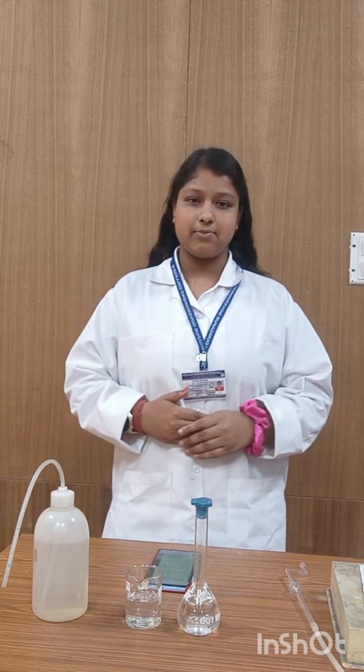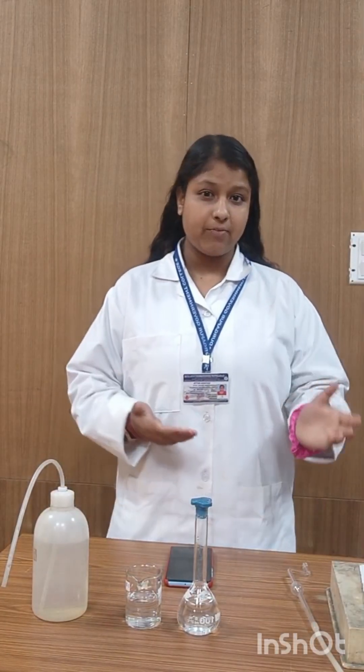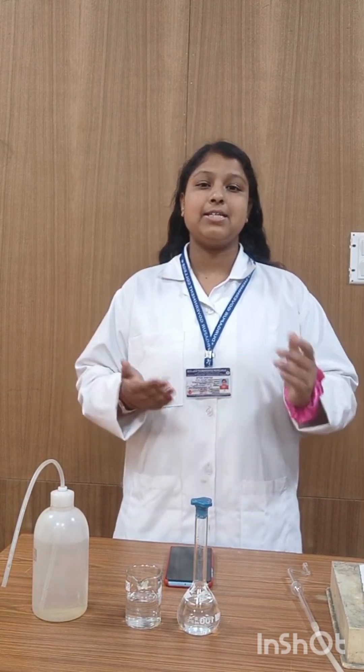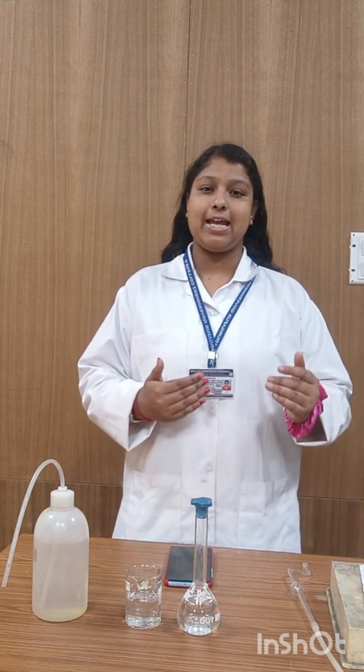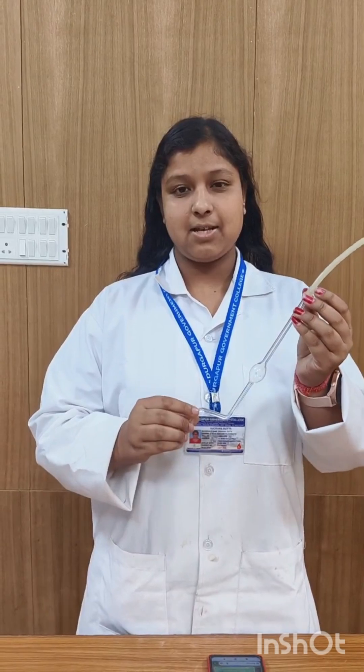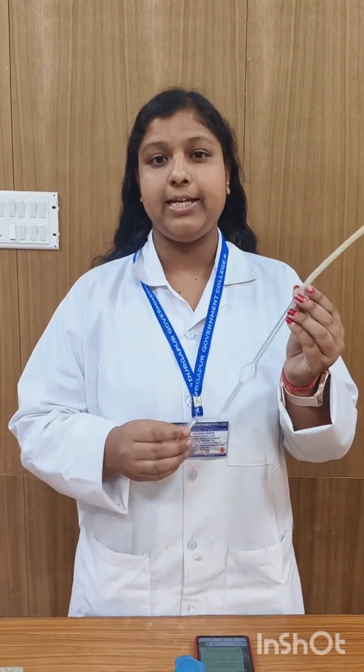So first, what is surface tension? Surface tension is the property of a liquid that makes the surface act like a stretched elastic sheet. To measure surface tension, we use the device called the Stalagmometer. It works on the principle called the drop weight method.